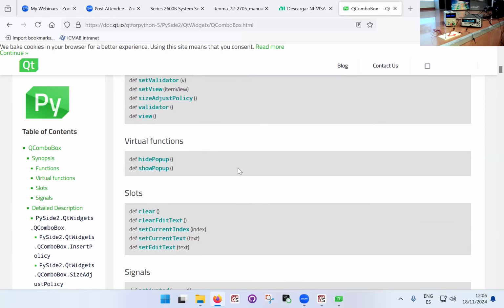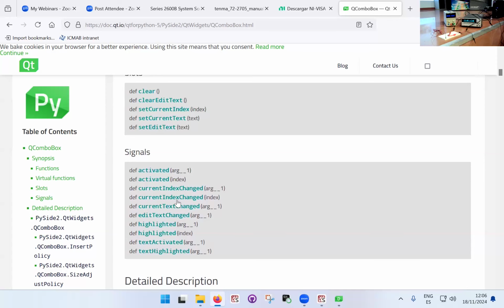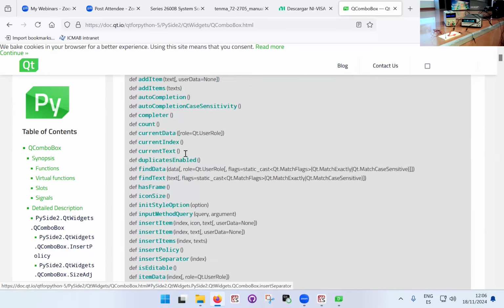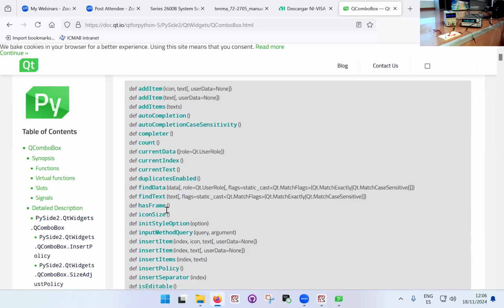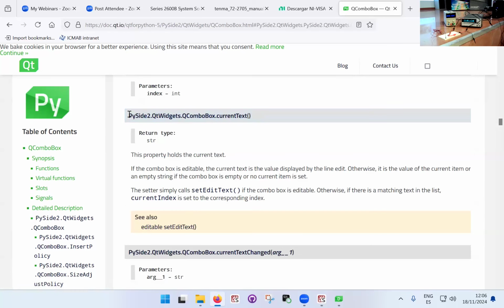The one that I want is probably one of these, get something. Let's see, because I've got it in my notes. I'll just give it a very quick look. Current text. This is the one that I want. Okay. Current text. Yeah, Qt. Well, you see that this comes up as PySide2.